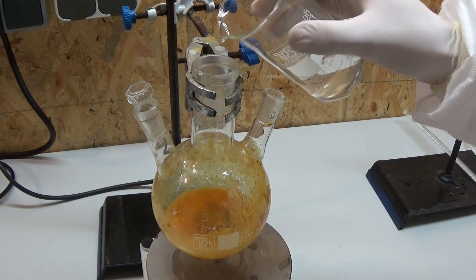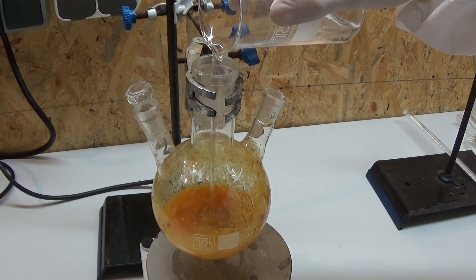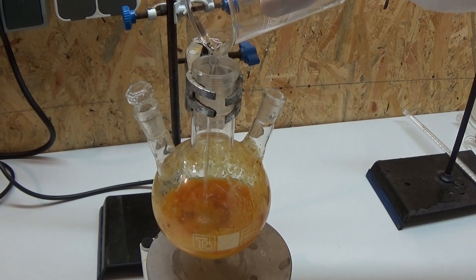For the work up 20 milliliters of water are added, and the mixture is stirred up. This is then put aside to separate out two layers.